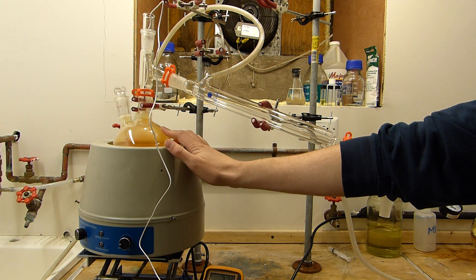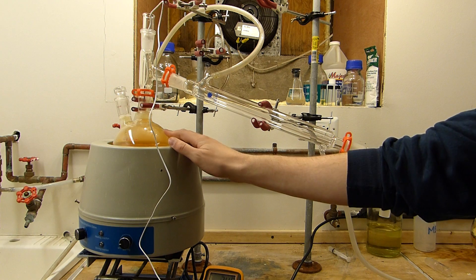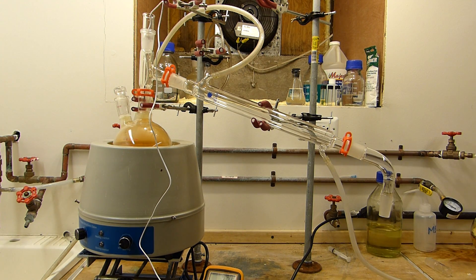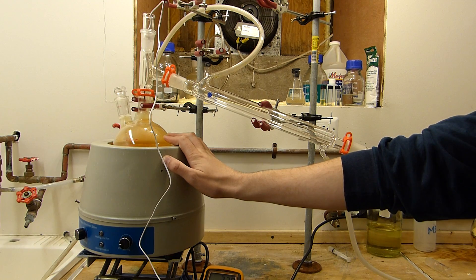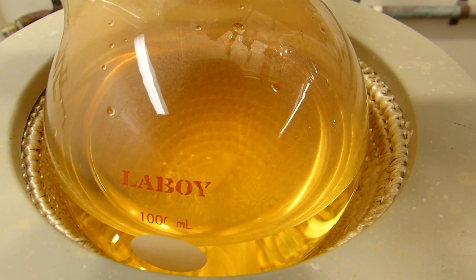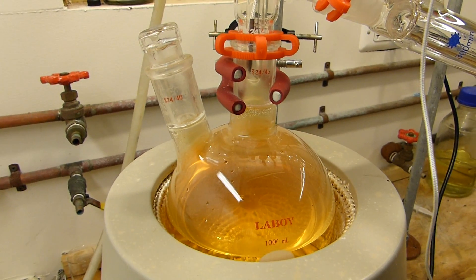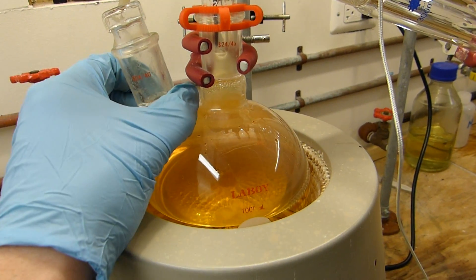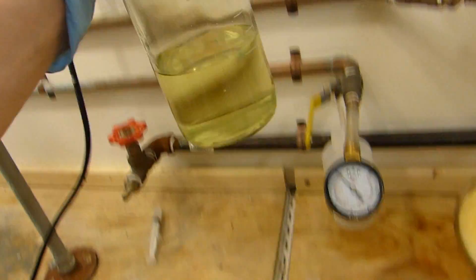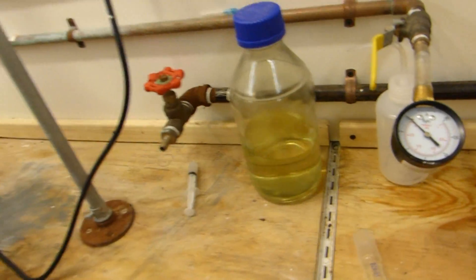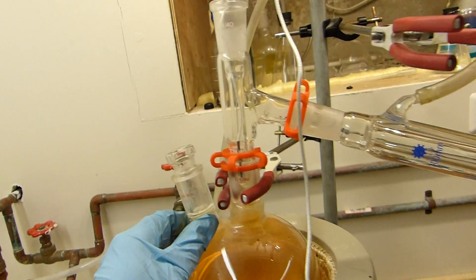Now those nitrogen oxides that are coloring this brown will also leave, since the solubility of gases decreases with the increase of heat in a liquid. So we'll automatically drive these nitrogen oxides off as the process continues. If you really wanted to, you can actually bubble air through this using like a fish tank bubbler or something like that to remove the nitrogen oxides prior to distillation, but I've never really found this necessary. I've also added a stir bar, which will help prevent bumping. You can use boiling chips too. I should also mention that because I'm equipped with the two-neck flask, I can actually distill some other nitric acid that I've been saving for years. In a previous run that I did about a year ago, I had the foam over issue and ended up with some dirty nitric acid. And so I'm going to go ahead and distill that really quickly once this run is over, by pouring it through this second neck here after the flask is cool. That way I don't have to disassemble all this stuff.